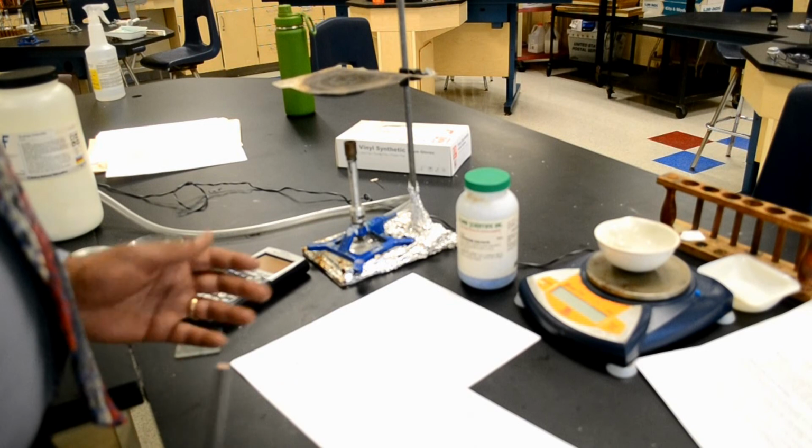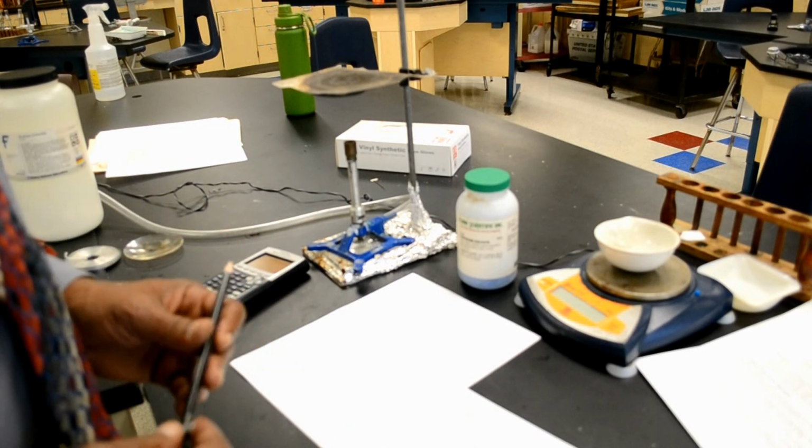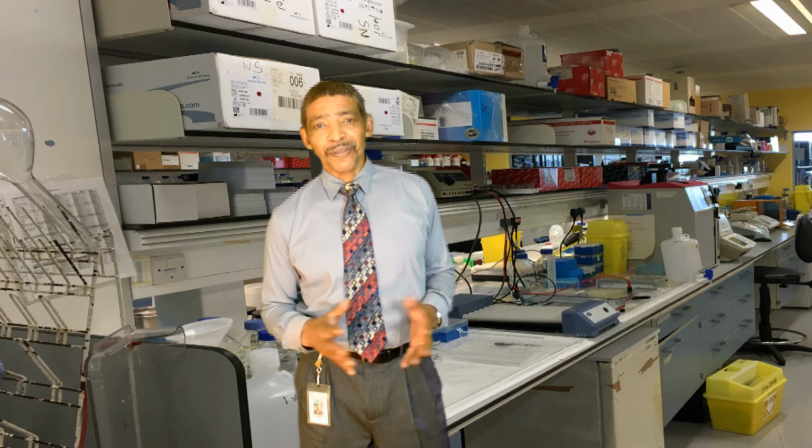So if you're doing this lab in class, just remember, try to follow the instructions, okay? All right. So as you can see, the results from the experiment don't always go as planned, especially when you don't follow the protocol, as I didn't this time. But in general, the procedure that I just showed you is exactly how you find the percent of water and moles of water in a hydrated compound.